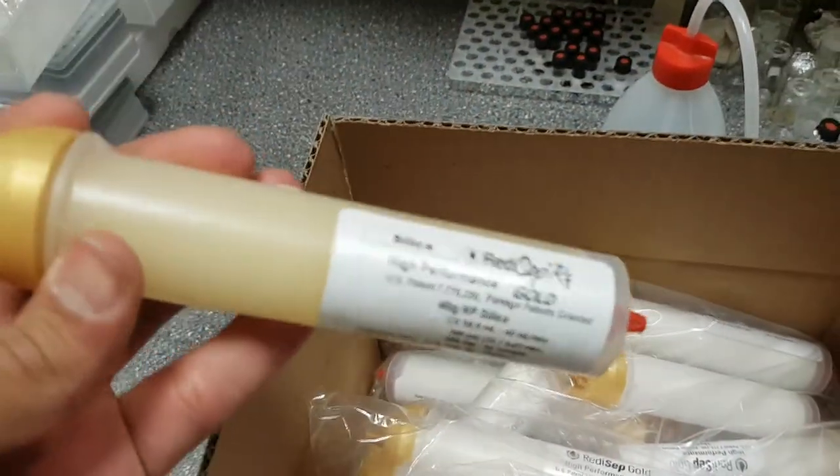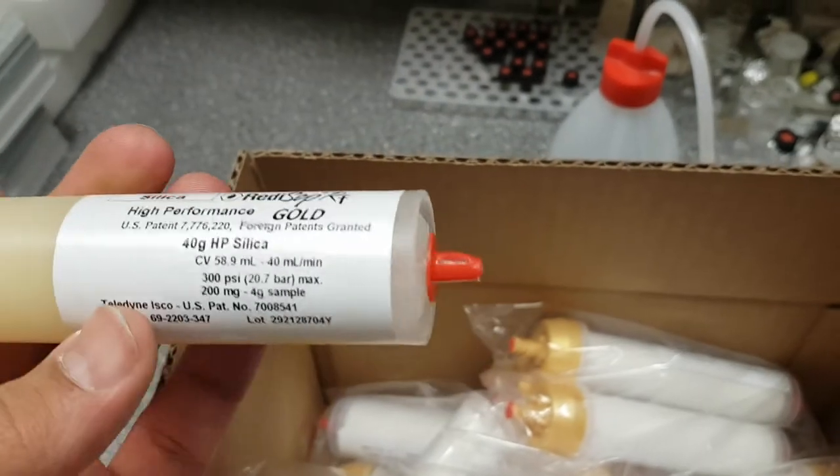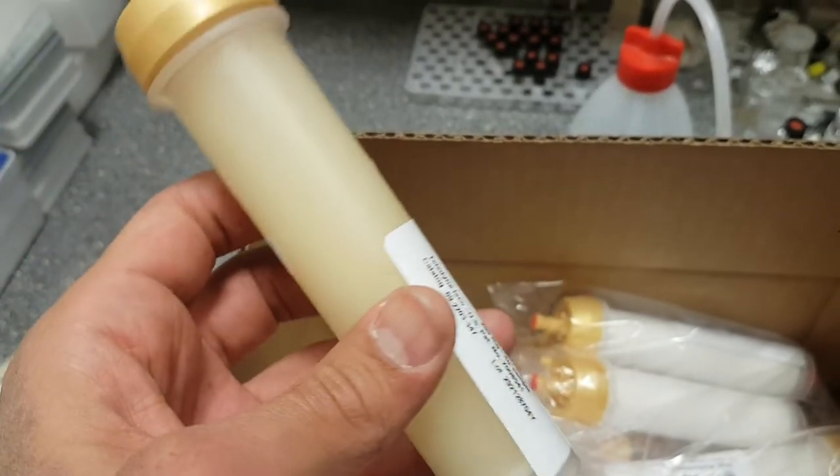I'll show you. This is my own column that I usually use. I can load it between 200 milligrams and 4 grams.